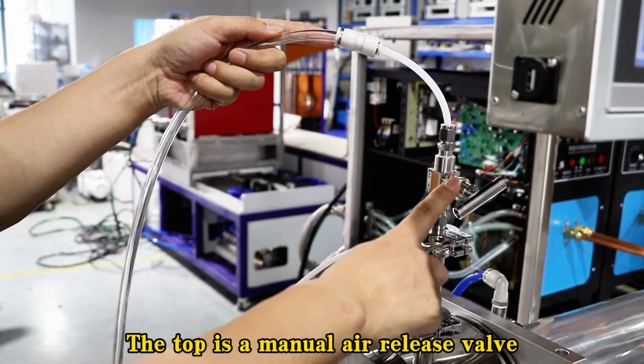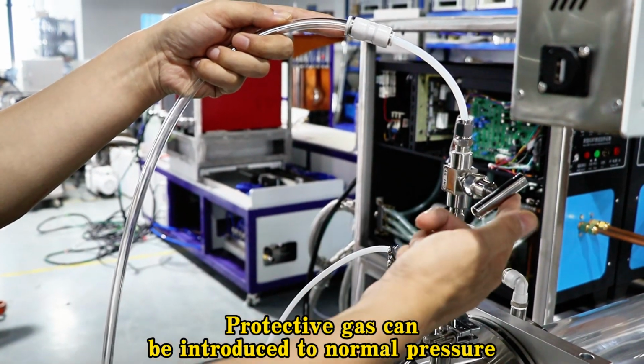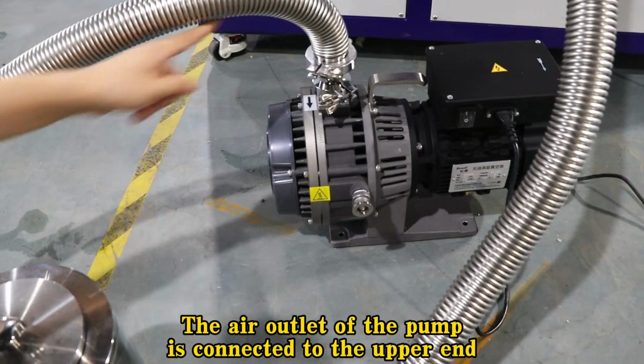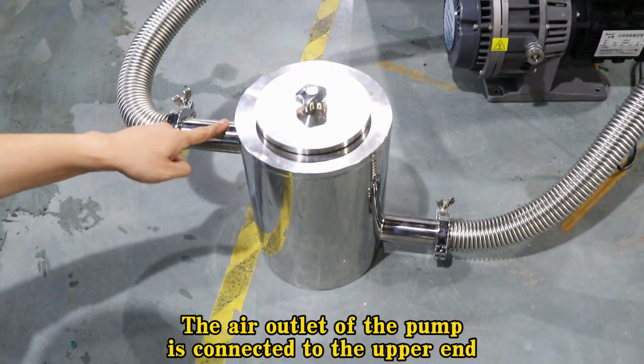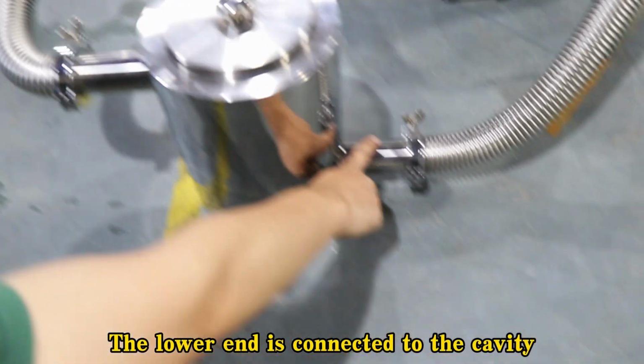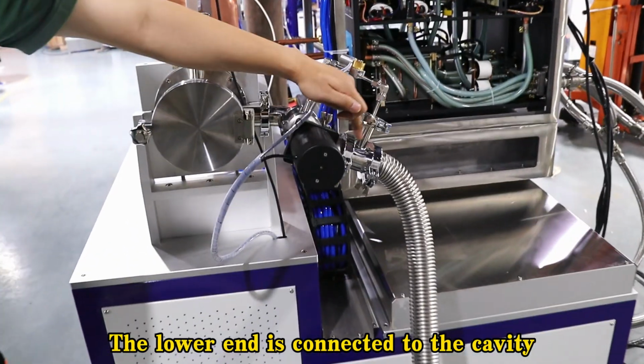The top is a manual air release valve. Protective gases can be introduced to normal pressure by turning it manually. The air outlet of the pump is connected to the upper end. The lower end is connected to the cavity.